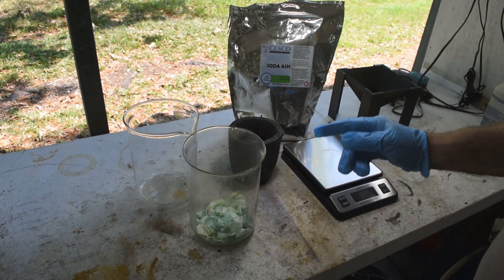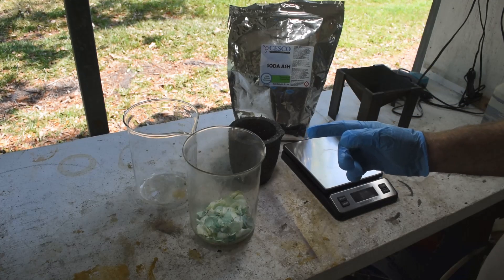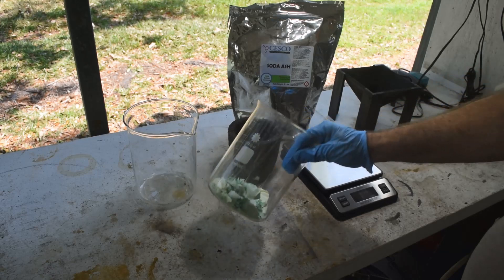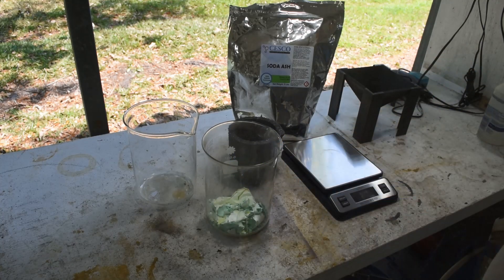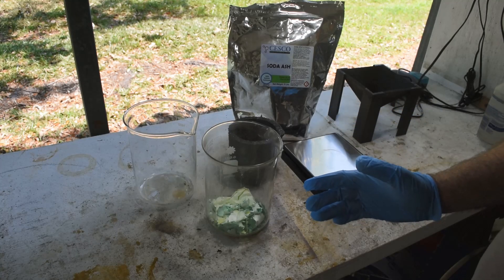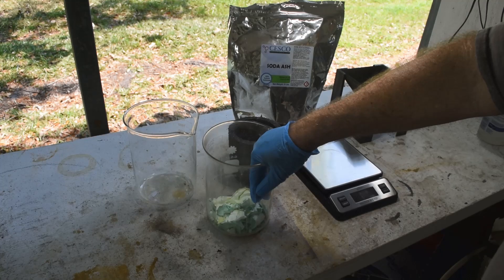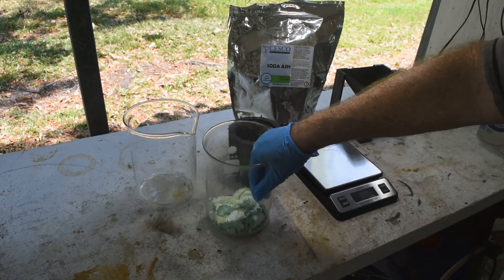I still can't repeatably get tin out of chloride solutions where you've got a lot of stannous chloride. I'm still working on that, still having a lot of trouble with that. But if you happen to have a lot of metastannic acid waste laying around, which is what this blue-gray stuff in these filters is, I think I have a way to get it out — convert the metastannic acid back to tin. Going from stannous to stannic with tin is very difficult, that's a tough nut to crack. Once you've got stannic tin, that's fairly easy to reduce back to tin. But the stannous tin, not so much. I'm referring to different oxidation states of tin — stannic versus stannous. A little basic chemistry there.